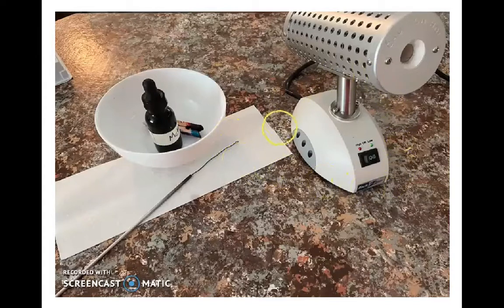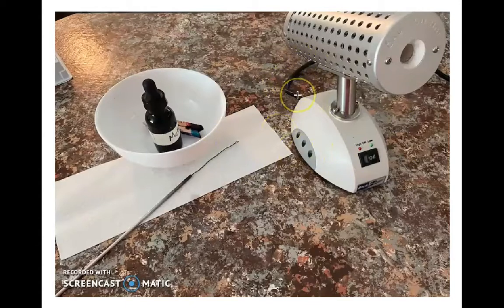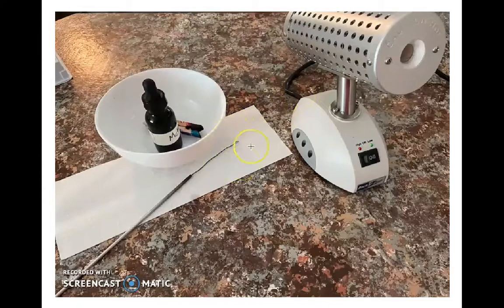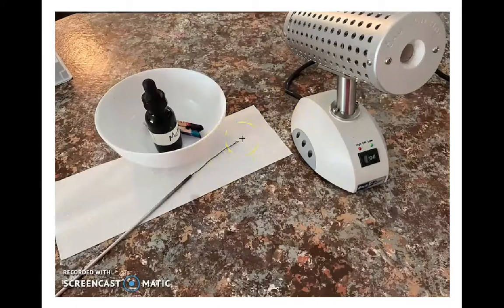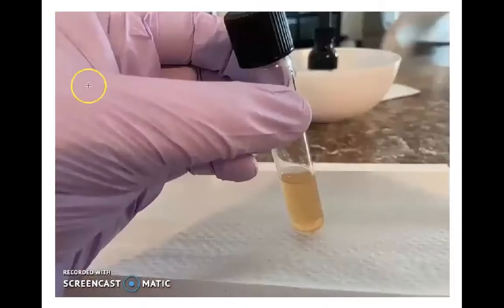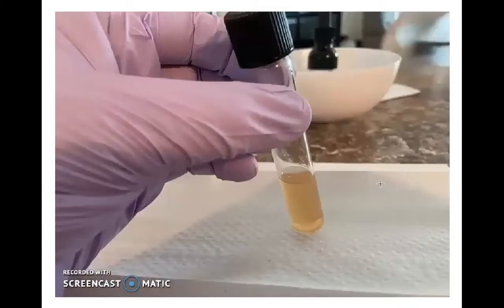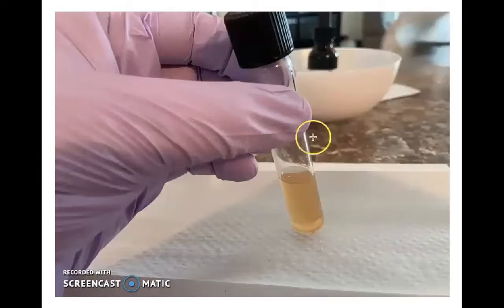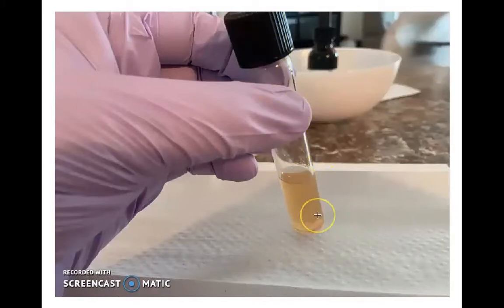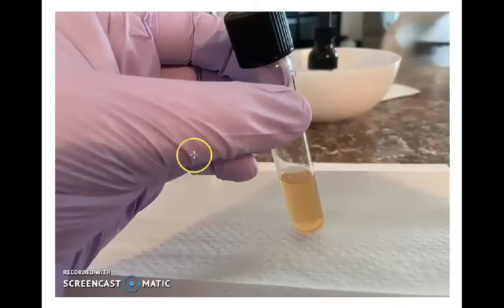Over on the right-hand side you can see an incinerator — an electric device that gets hot enough to allow us to sterilize the wire on an inoculating loop. I'm holding a nutrient broth culture in a test tube that has bacteria growing in it, which I've just pulled out of the incubator and am now ready to examine.